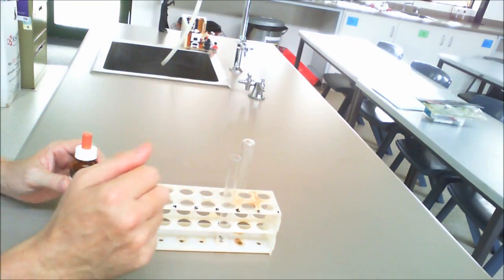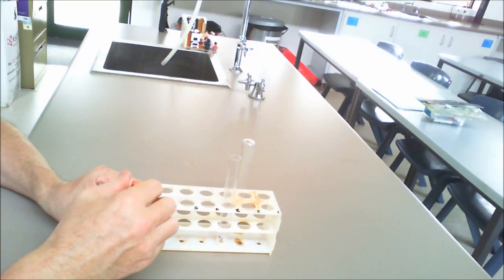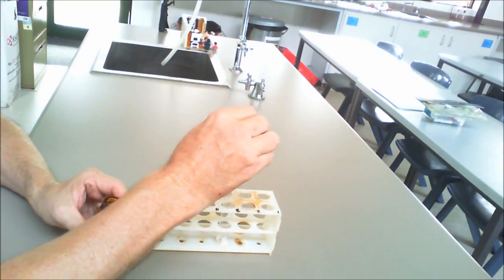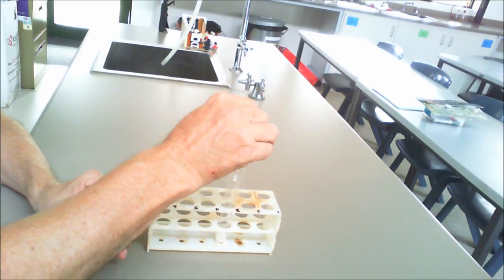Now what we'll then do is we'll place the acid over the top and that will bubble up, and that will show us that a chemical reaction is occurring, and you can see that in the bottom there.